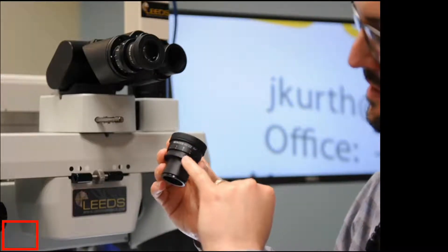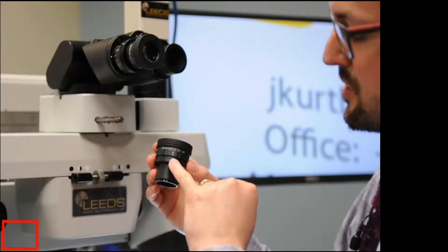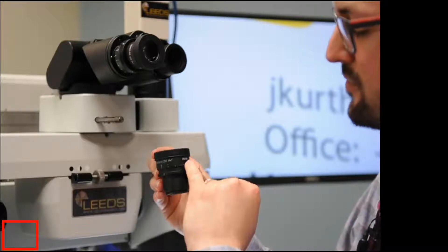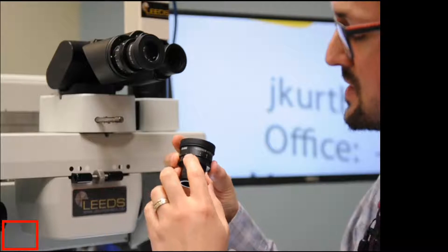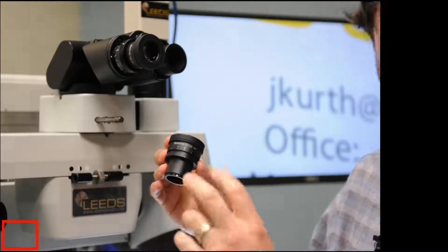And so that's exactly what's happened here, is my right eye is just slightly negative to zero. And what you'll see is that these diopter numbers go up in whole steps. So it goes from zero, and this is a little negative sign, so negative one, negative two, negative three, negative four. And it goes in the other direction as well, so positive one, positive two, positive three. So my right eye is just a little shy, just a skosh, negative.